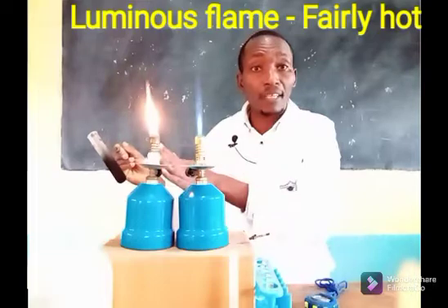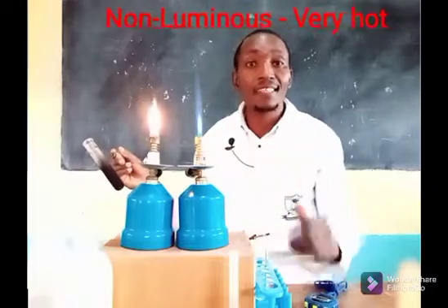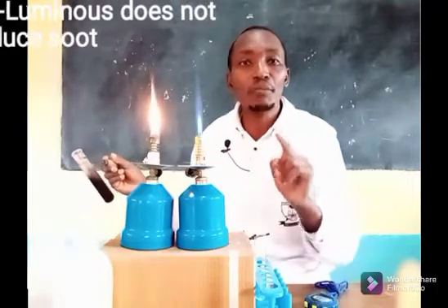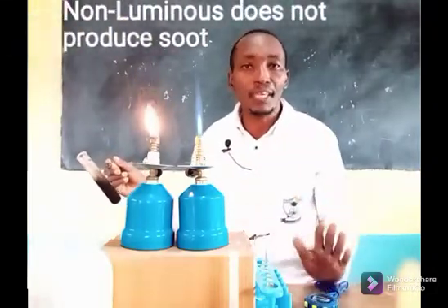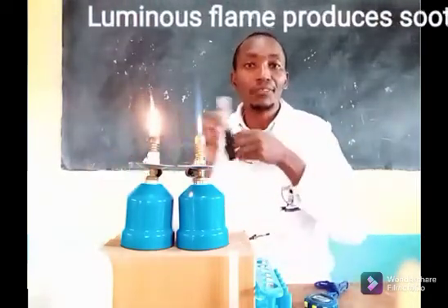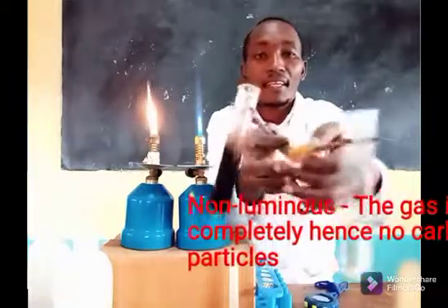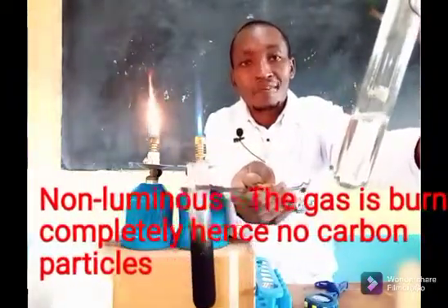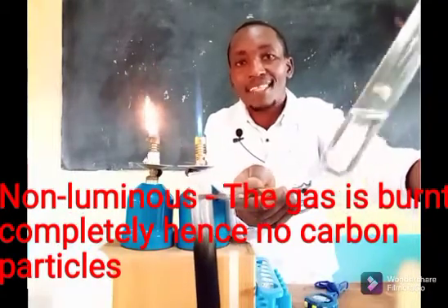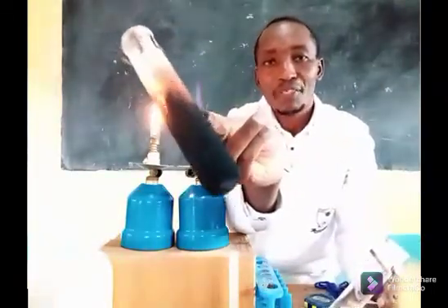The non-luminous flame is very hot while the luminous flame is less hot. Also, the non-luminous flame did not produce soot — it was not smoky at all. But the luminous flame is smoky and produces soot. If you look at the boiling tube used with the non-luminous flame, it remained very clear and clean. The luminous flame produces soot on the boiling tube.